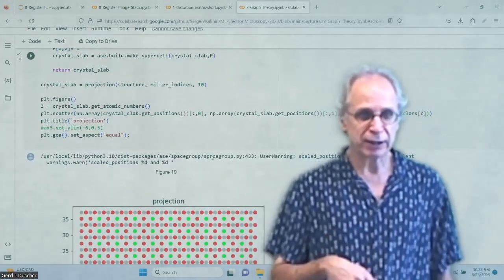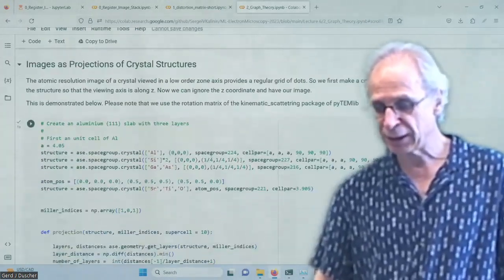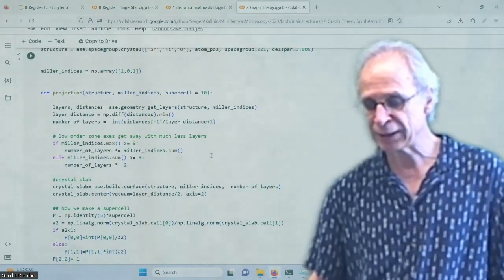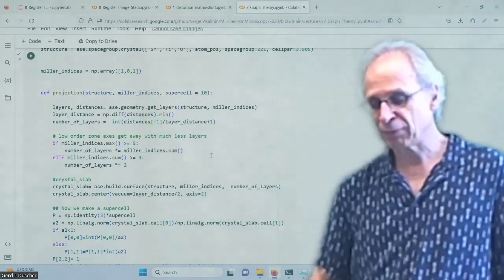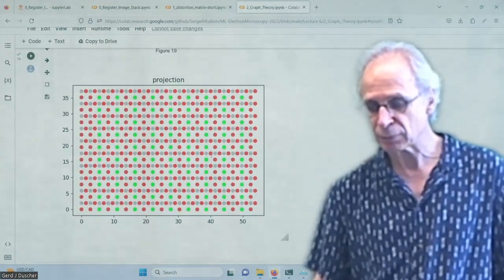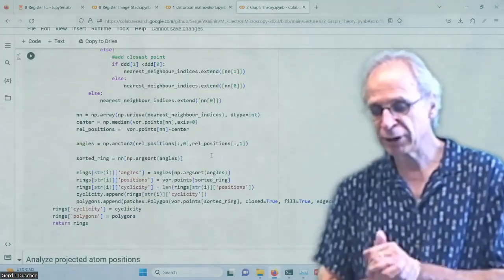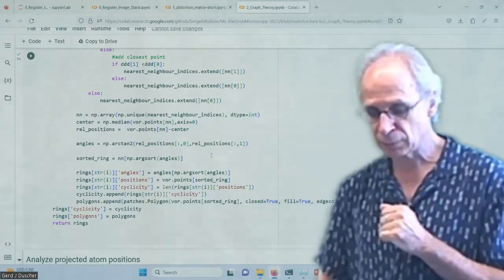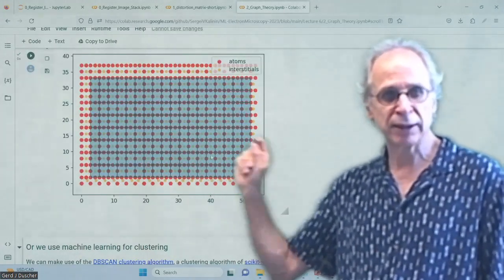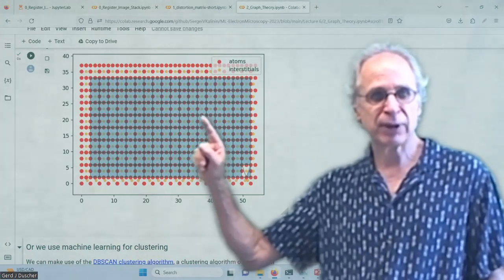If we do a relatively complicated one, it would be strontium titanate in the 1,1,0 direction. So we know how to do strontium titanate. And I just do the same thing as I did before. We can do different ones here, but we use strontium titanate. And I go into the 101 direction, get a projection. And that is it, right? And then I make a ring graph out of that, as I did before. Then I get my rings. I get my centers of the ring.